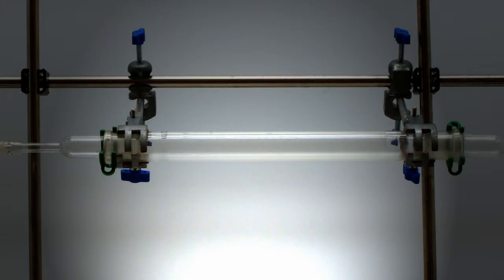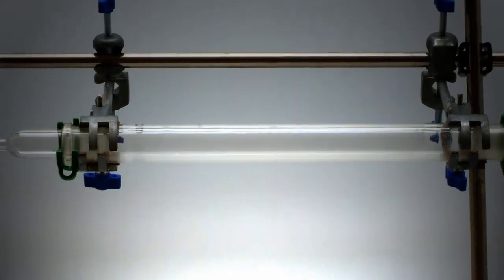Chlorine from a cylinder is used for this reaction. For the reactive alkali metals, the tube is first purged with argon. A small butane torch is used to provide heating. The metal has been cleaned and stored under argon.